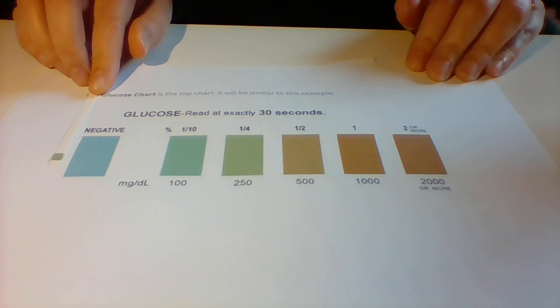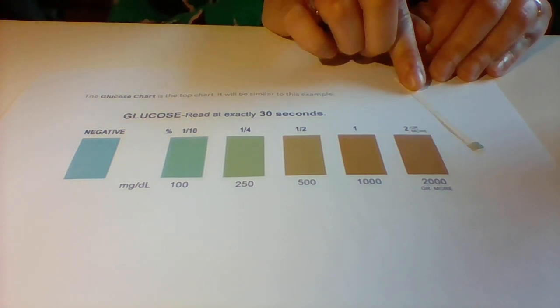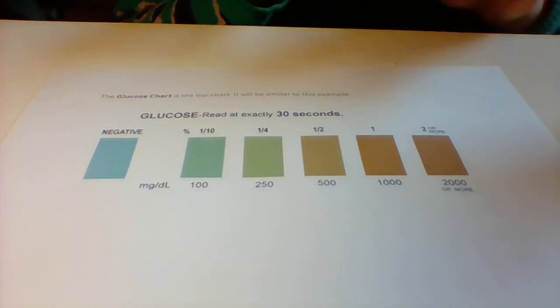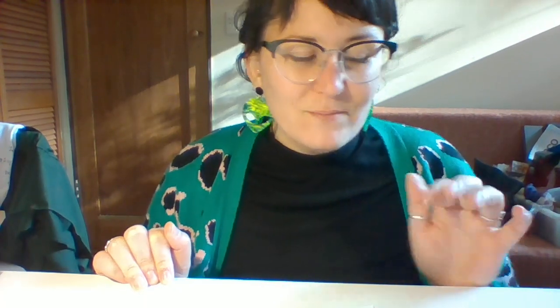And then I'm just going to slowly, really slowly move the strip along there, and you have to figure out which color you think it matches the most, and then in turn take down the reading of that, what the concentration of sugar is in their plasma at that time. And from these results, you should be able to tell which one has diabetes. You should be able to tell if they took insulin, or if they've eaten. All right, anyway, we'll get started.